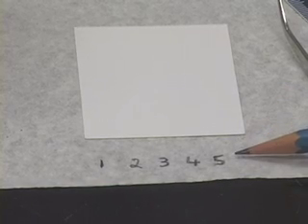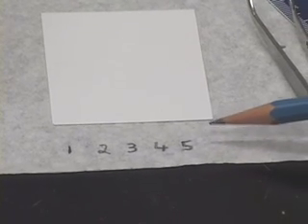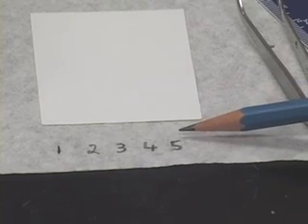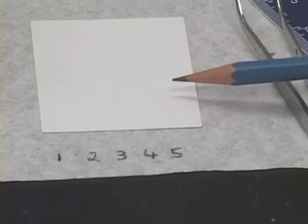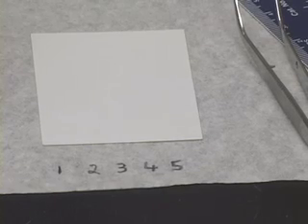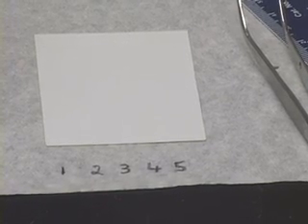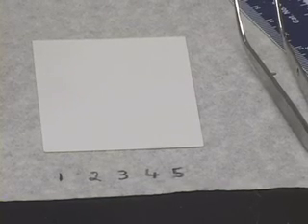Now, coming to spot 5, which was due to the unknown, you may notice that this sample unknown 5 gave either only one spot, or there may be 2 spots, or there may be more than 2 spots. It all depends on how many components are present in your unknown.